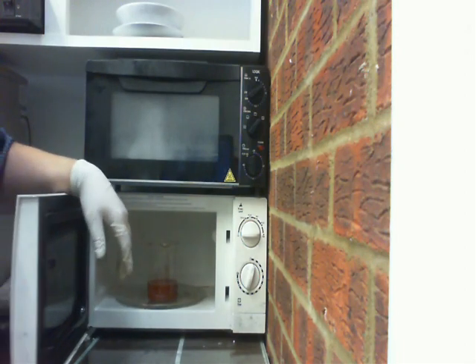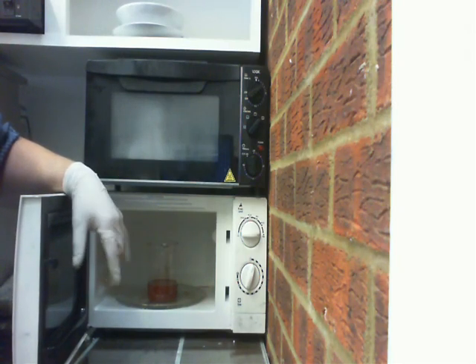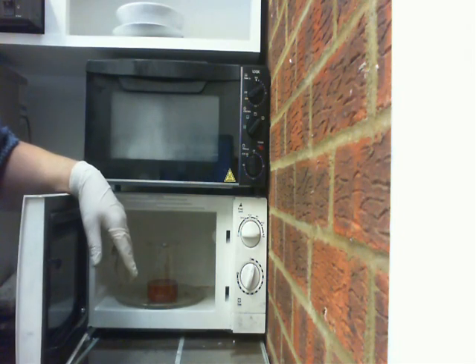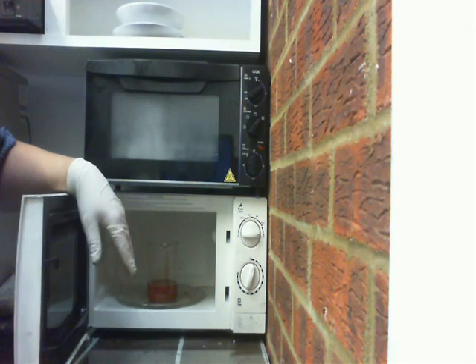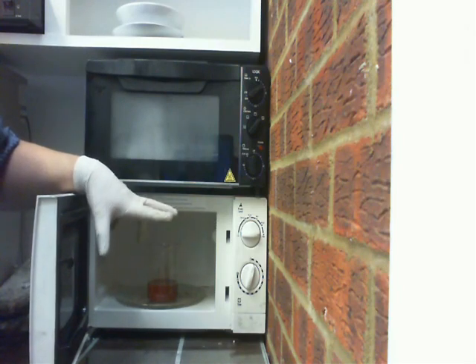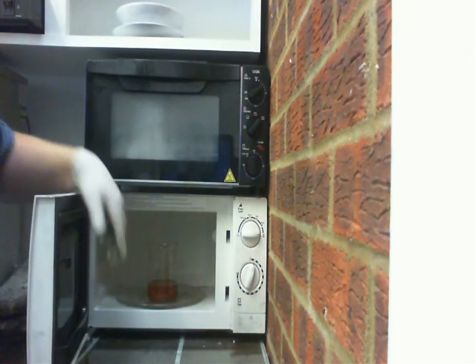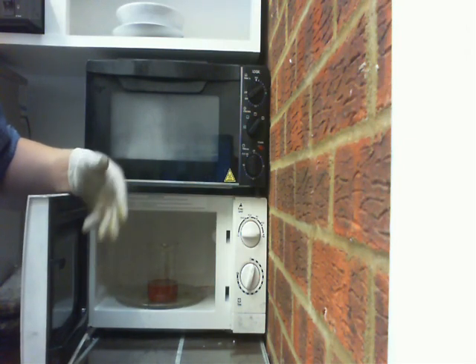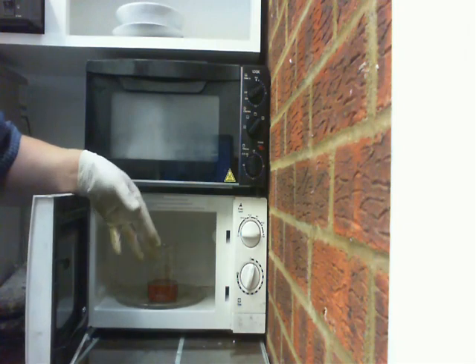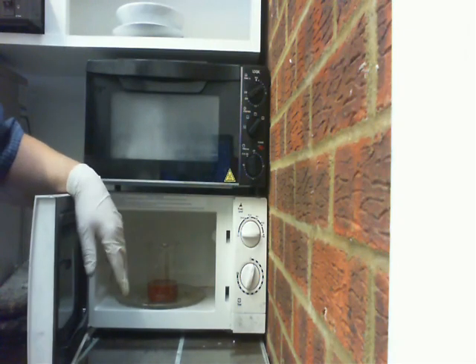I'm using formic acid here — it's the same stuff you find in kettle descaler and also in ants. This is 85% formic acid, hence the gloves: if you get this in any cuts it stings like mad, like liquid fire. If you're uncomfortable with formic acid, you can use ascorbic acid instead, though it means ascorbic acid remains in the ink and can be harder to remove. With formic acid everything converts to copper formate, which under photonic sintering or heat just dissociates back into copper, releasing a bit of carbon dioxide and water.